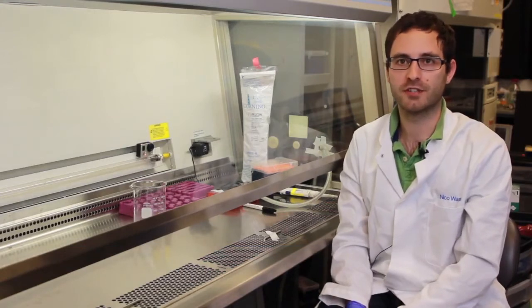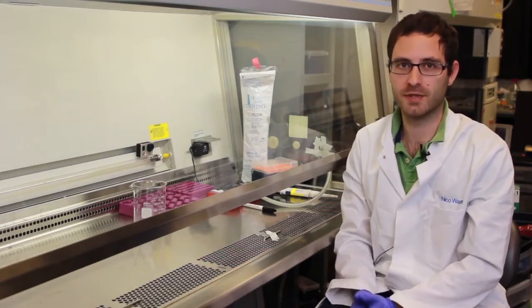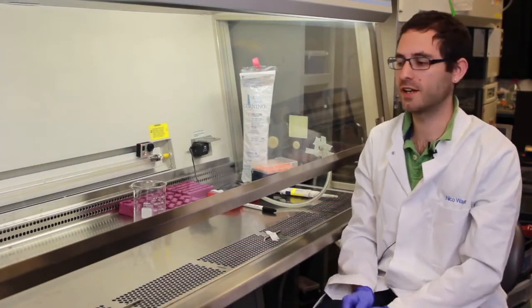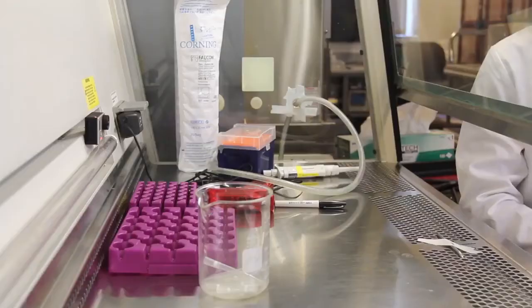Hi, I'm Nico. I'm a fourth year PhD student working with Victoria D'Souza and as part of my research project I often use human cells and the best way to work with human cells is in a tissue culture hood like this one.